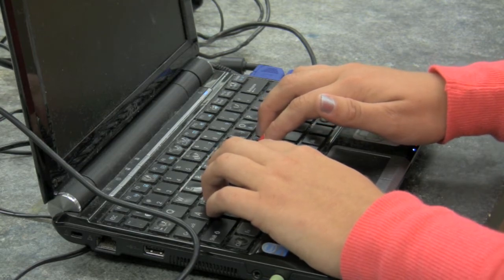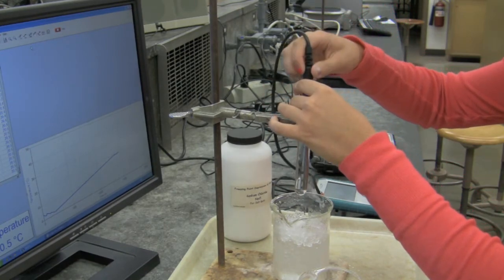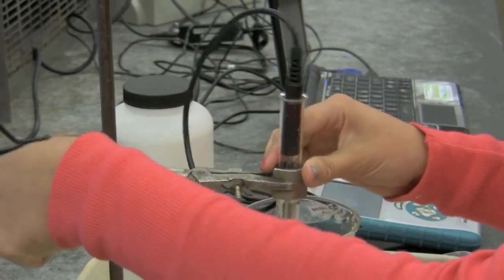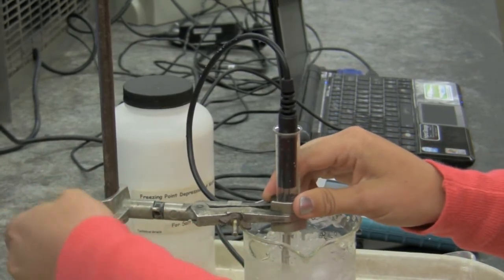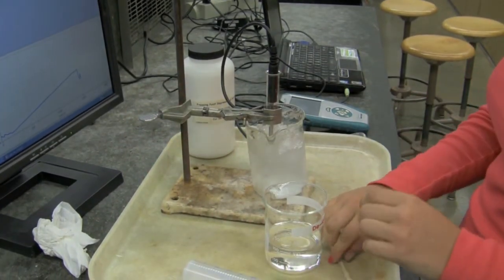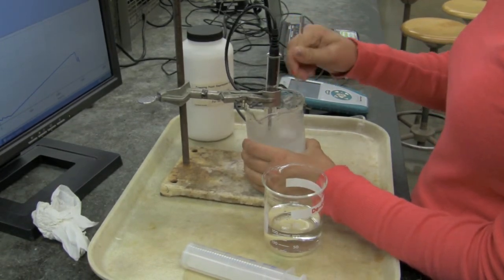Logger Pro reads an initial temperature of 19.8°C on the Cartesian graph of temperature versus time. The student places a temperature probe in a test tube of distilled water. The test tube is attached to a lab stand by a clamp, which she lowers so part of the test tube is submerged in the ice water. Temperature readings drop rapidly: 15.3, 13.5, 12.6, 11.8, 10.9°C.